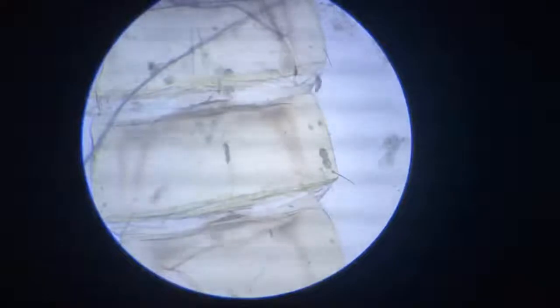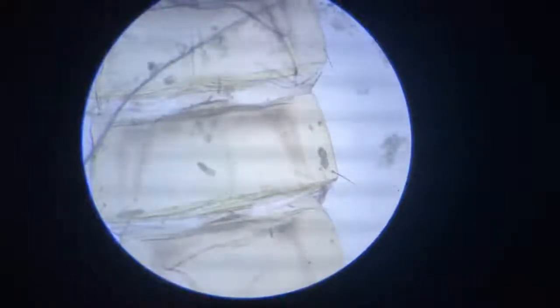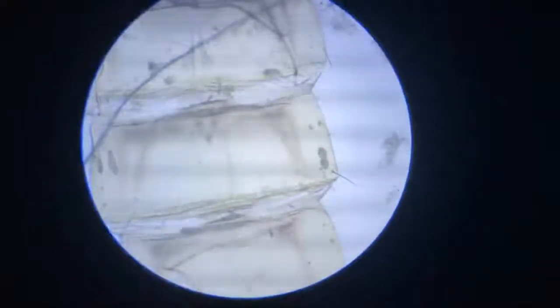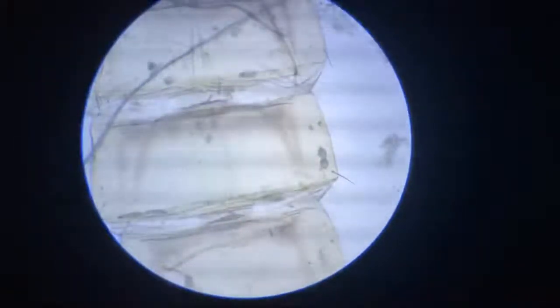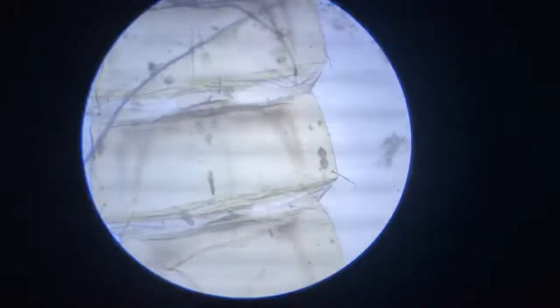What we see here is the dead body casting of a dipteran, and this body is becoming an apartment, a building for various ciliates. We see a lot of ciliates in here, occupying this body as a house.